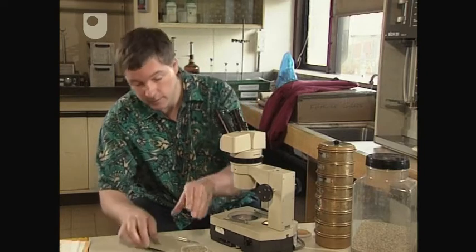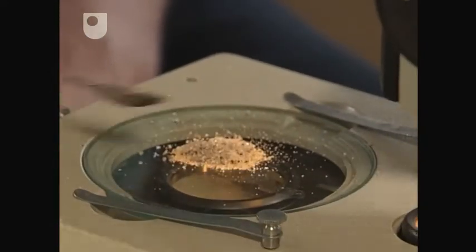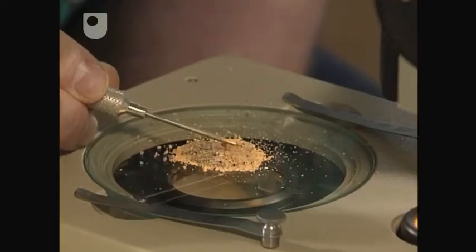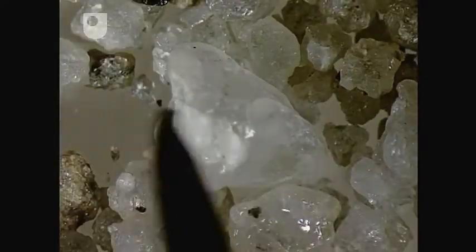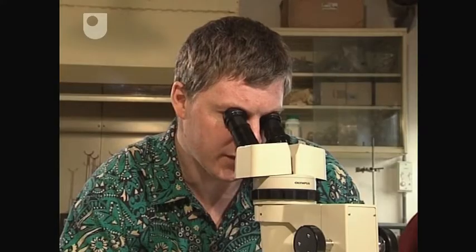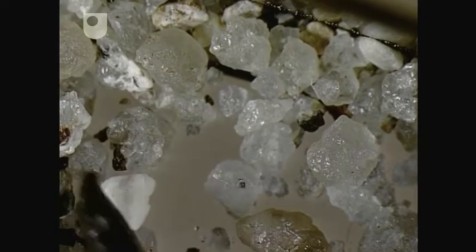Here's some sand I got back from the beach. This is a lovely sand — lots of large quartz crystals, which are fairly angular, and have nice reflecting surfaces on them. There's also some white, creamy feldspars, and there are some lovely little dark mica flakes, and also some clear mica flakes. I'm particularly interested in the shapes and surface textures of these quartz grains, because they can tell me a lot about what's happened to the quartz grains in the sand.